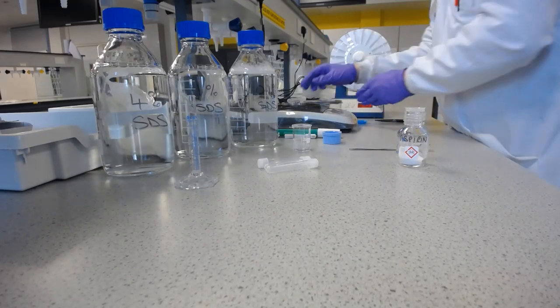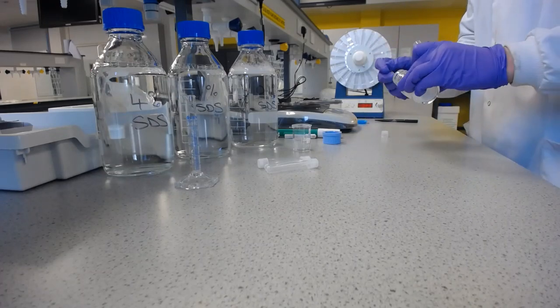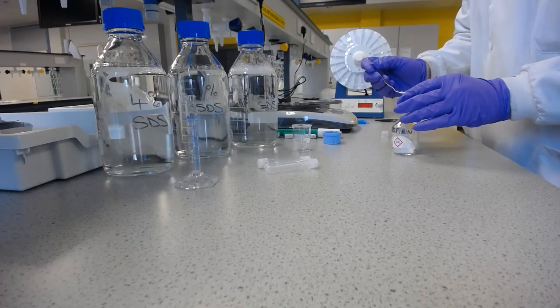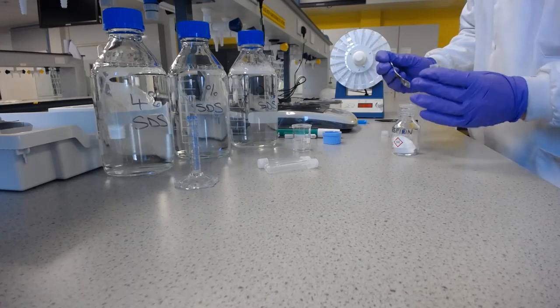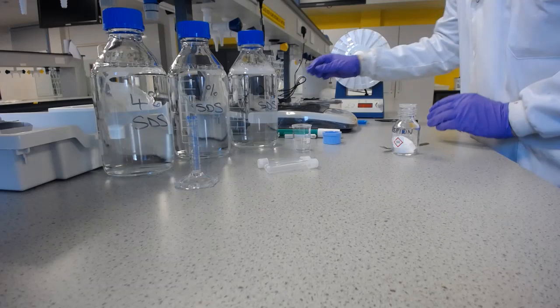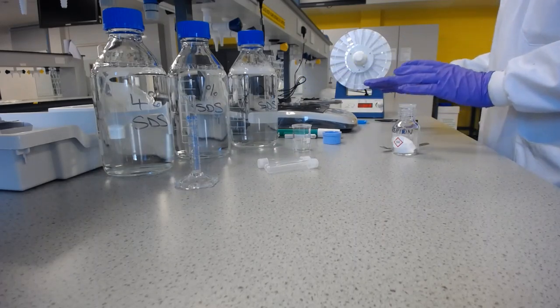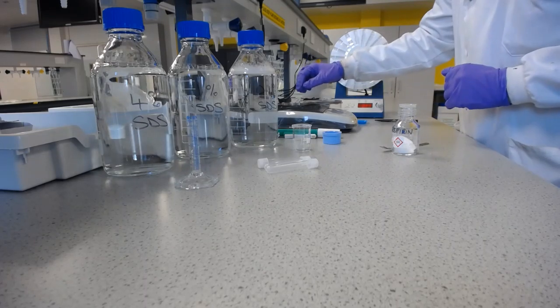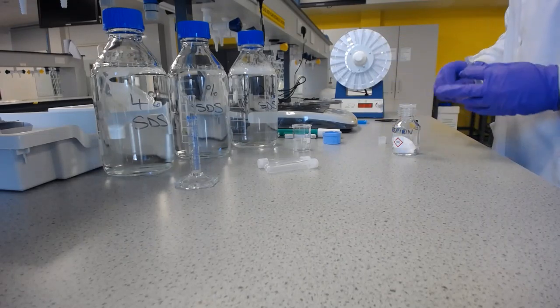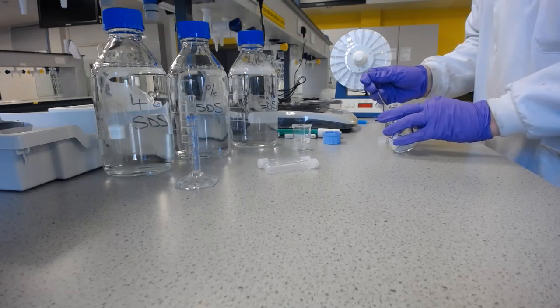Now this will require me to take it off the balance, and with a clean spatula I'm going to have to put some in, see how much it weighs, and then come back and do that as an iterative process. Now I'm not going to put the cover on each time. I'm going to put the cover on when I get close to the final value, so I know how accurately I've put in. So I've got 70 milligrams with that, so I need to do about 3 more of those. So that's how I work out how much I'm putting in.